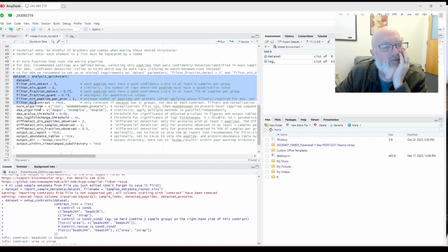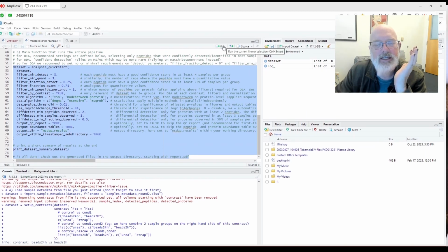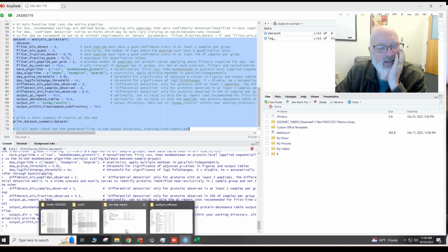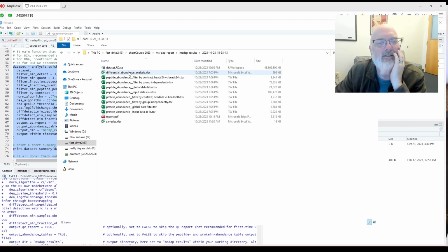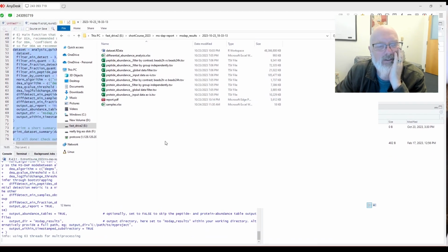Okay, so let's see. Now I'm going to do this again. And I'm going to hit run, and then it should save it as a new file in like 6 hours. So it looks like it's going to take like 6 hours. All right, so I go run, and let's see if that works. Okay, so it looks like it's loaded, and I should see a new results file today, and I do here, 11:38 a.m. on the 24th, and it's currently empty because it's still processing. Here's our old one.